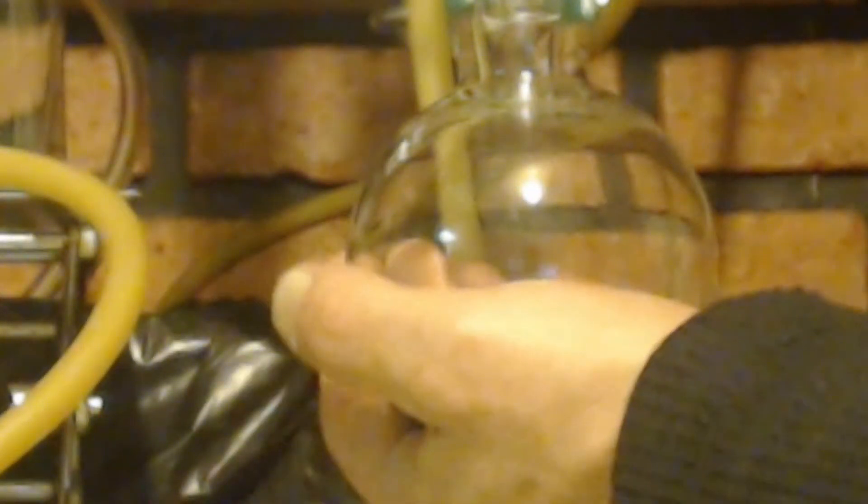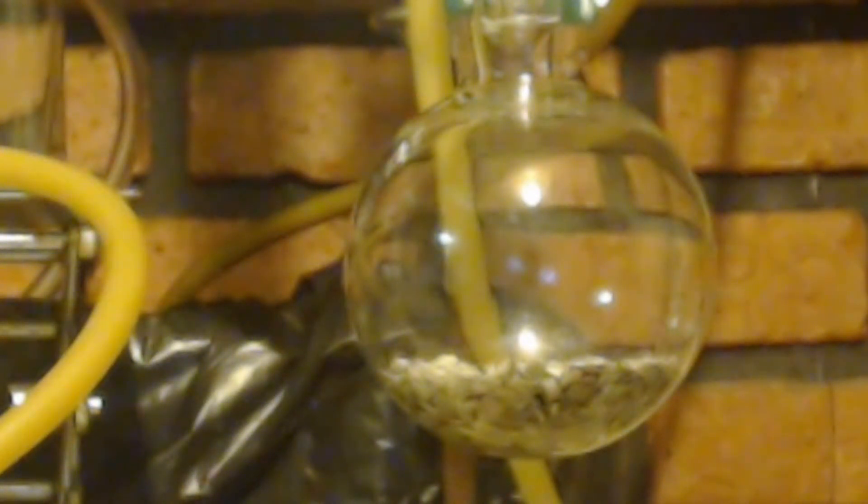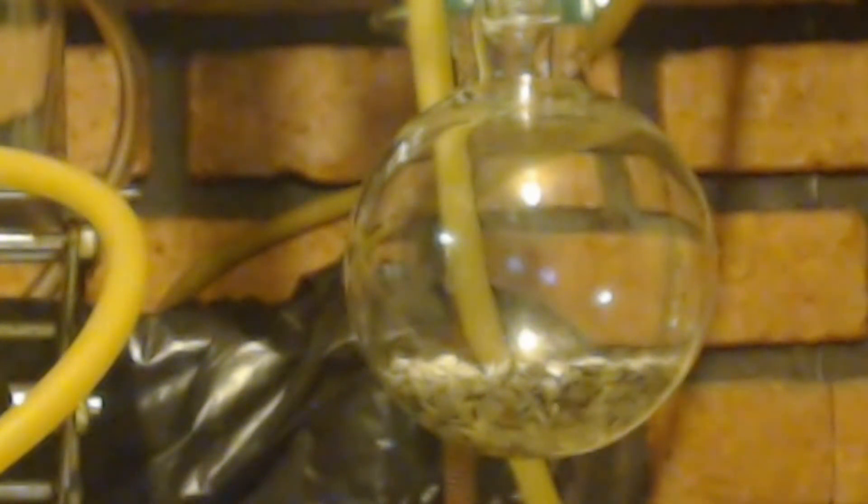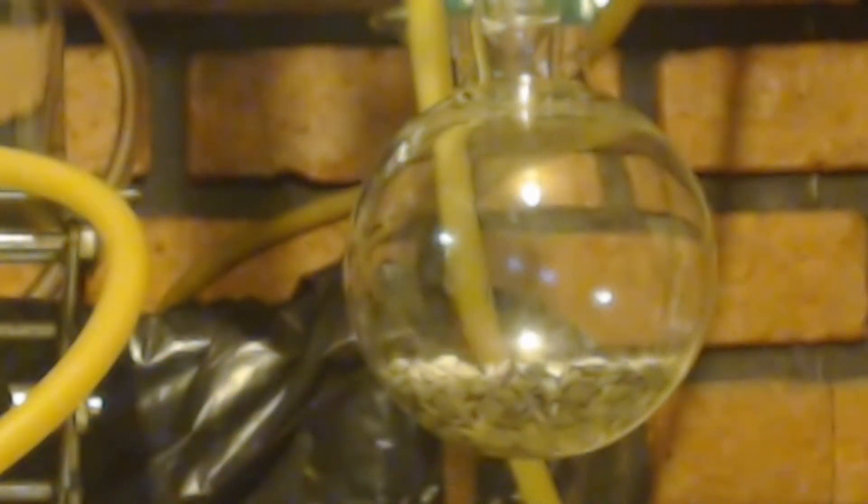Just trying to add it so it don't go crazy. You figure that the diethyl ether is at 34.6 or something like that. So you don't want it to go too high above that, I'm guessing. Keep in mind, this is my first Grignard. I've never done this. I'm not doing it from any instructions or whatever. It's been about 20 minutes so far. It's staying hot by itself. I'm not heating it up or doing anything. I'm just dripping it in. That's producing the heat.